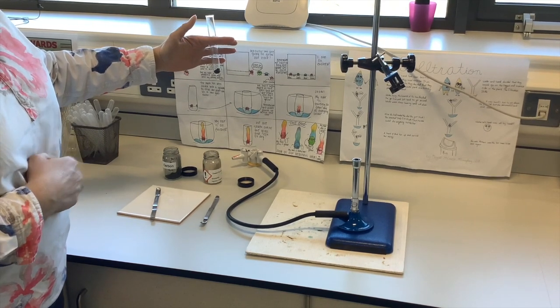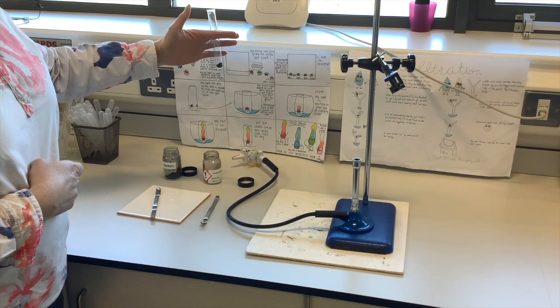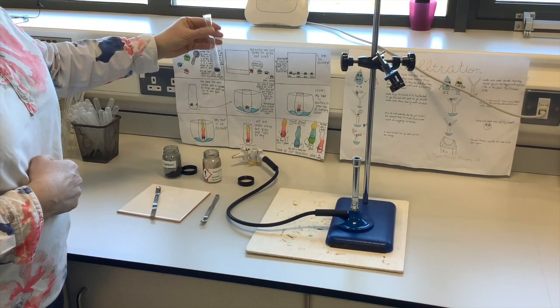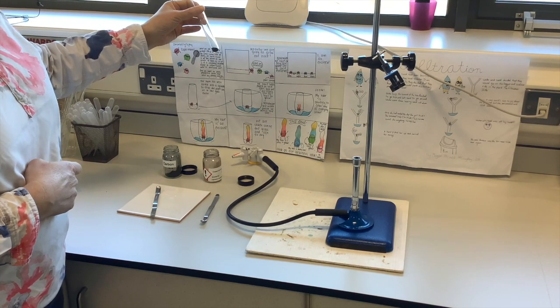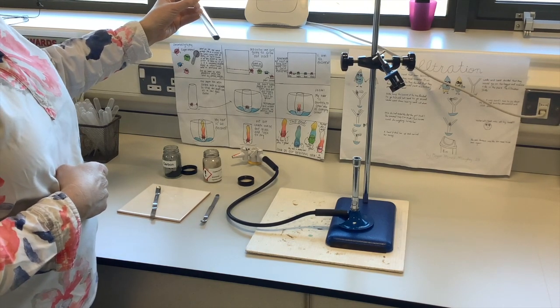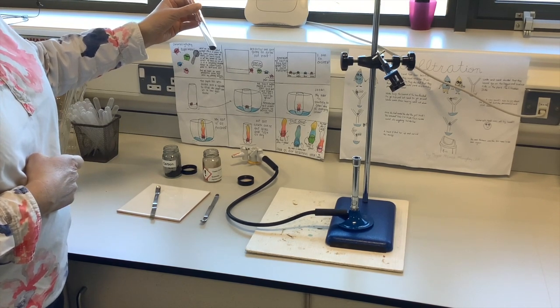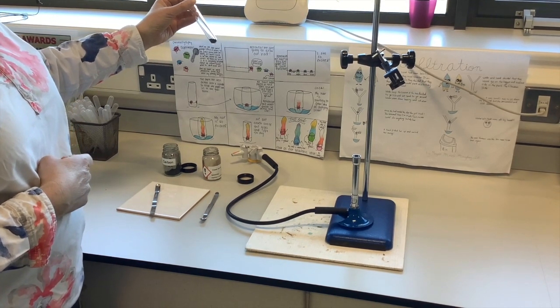Now, the reason why that might happen is if the carbon is more reactive than the copper. And so carbon is a non-metal. Up to now we've been looking at metal reactivity series, but carbon's a non-metal. And we know, just let you into a secret, that carbon is more reactive than copper, and so it should be able to steal the oxygen away from the copper. And if that happens, we should see little flecks of pure copper forming in the test tube. So in the next wee part of the video, you're going to see the Bunsen burner really heating this test tube strongly, and we're going to see if we've got any evidence of reaction taking place.